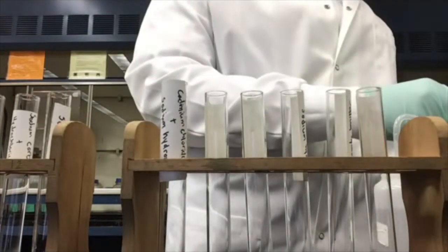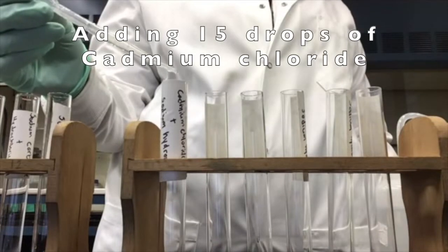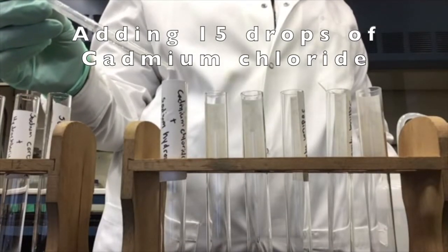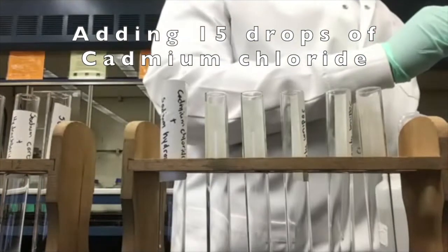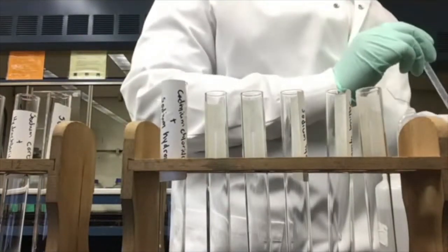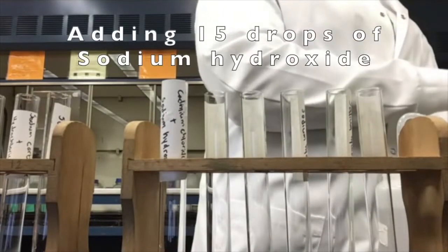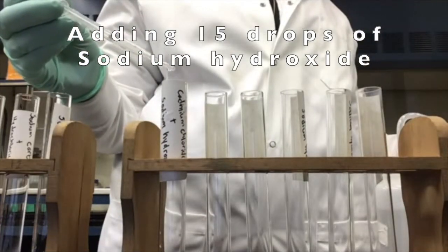To begin, we're going to add our 15 drops of cadmium chloride. After we add our cadmium chloride, it's time for our 15 drops of sodium hydroxide.